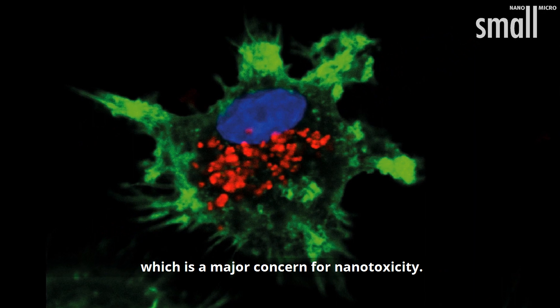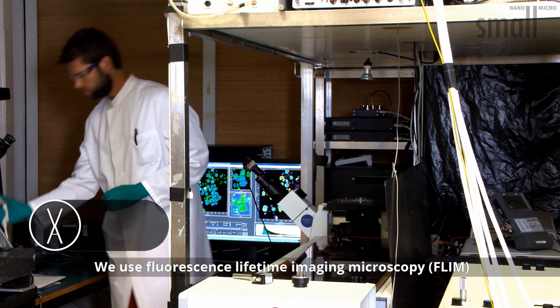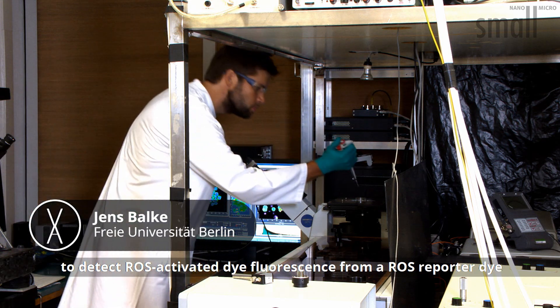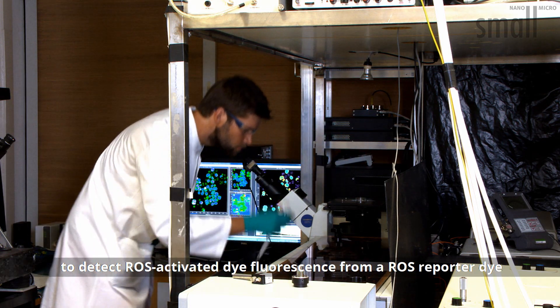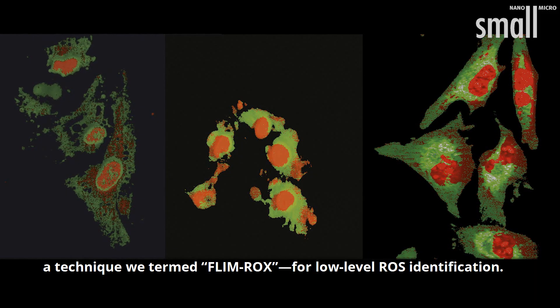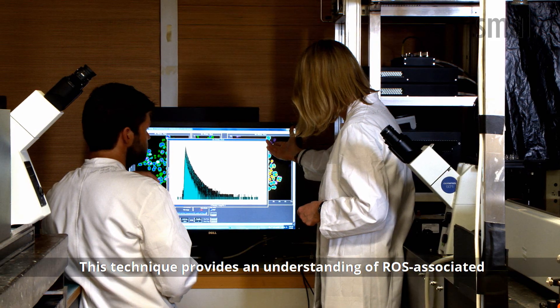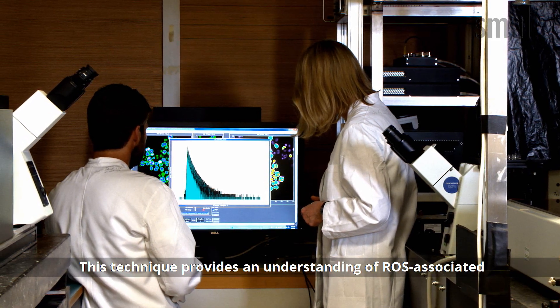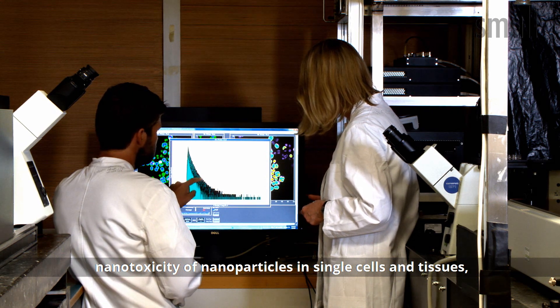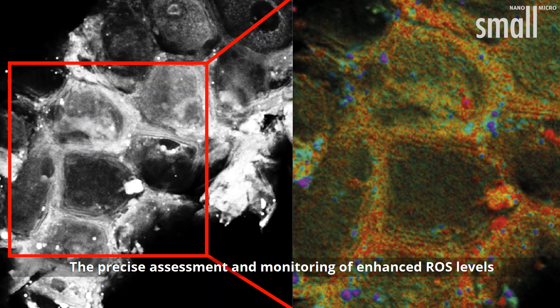We use Fluorescence Lifetime Imaging Microscopy (FLIM) to detect ROS-activated dye fluorescence from a ROS-reporter dye called CellROX Green, a technique we termed FLIMROx, for low-level ROS identification. This technique provides an understanding of ROS-associated nanotoxicity of nanoparticles in single cells and tissues and enables high-throughput analysis.